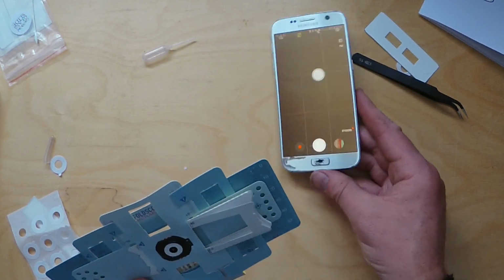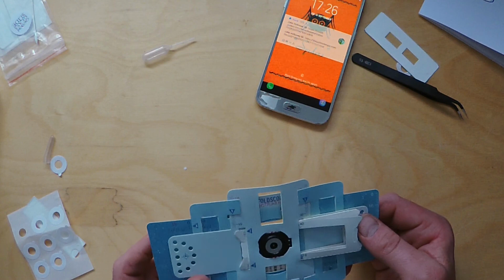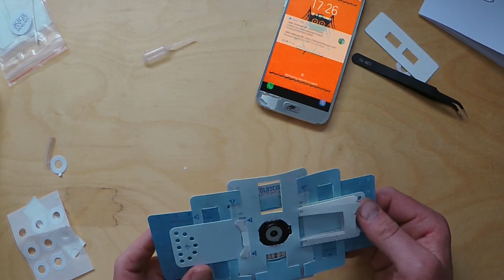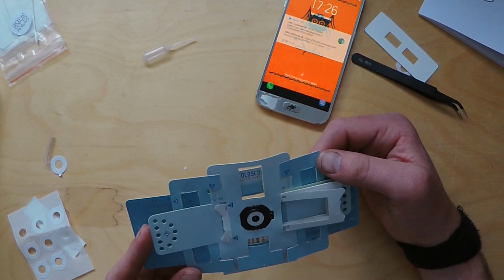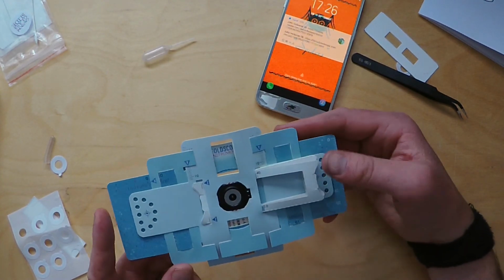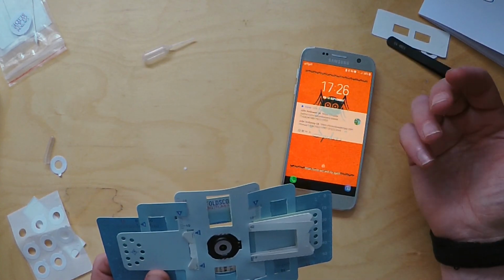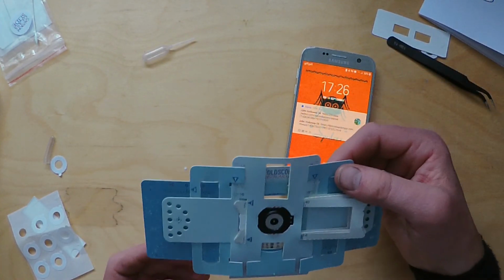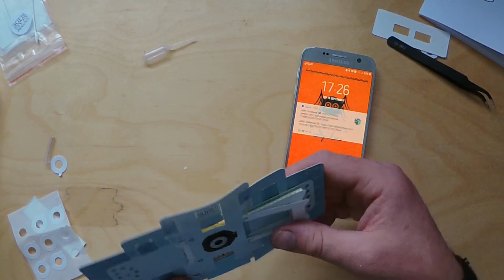I find using your phone is like the most rewarding thing really, because you can see it with the naked eye by holding it up to the light, but the phone means you can share it, it's a lot more social, you can zoom in. Yeah, it becomes like a really nice little platform. If you've ever tried to take a photograph from an actual standard microscope with a phone, it's quite difficult. It's actually easier to do it this way.